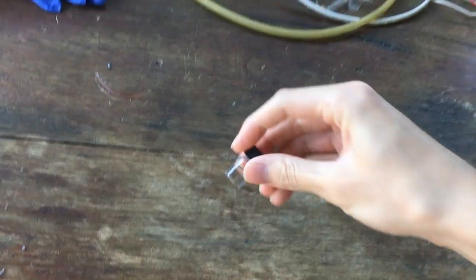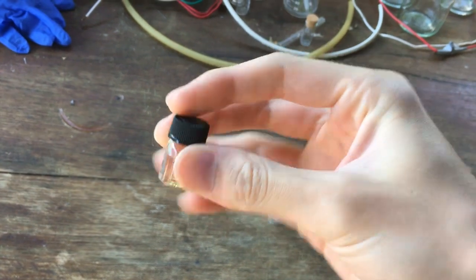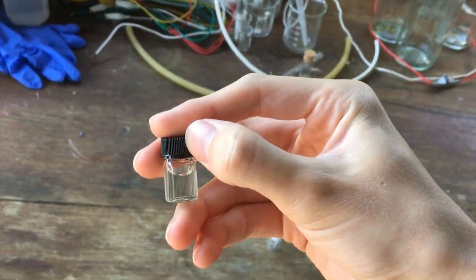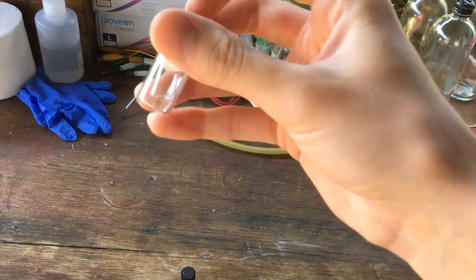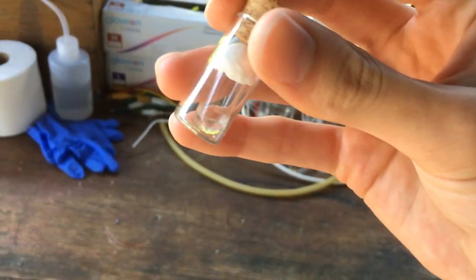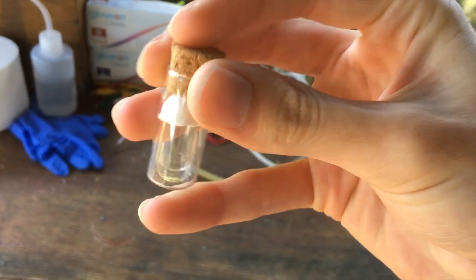It has now been 2 weeks, and the real heavy water that I ordered has come in the mail. It's 2.5 milliliters of, I'm pretty sure it's pretty pure, heavy water. So all the experiments that we were going to do with the heavy water that we made, well, the water that we made, you can see I've put it in a smaller container inside that vial.